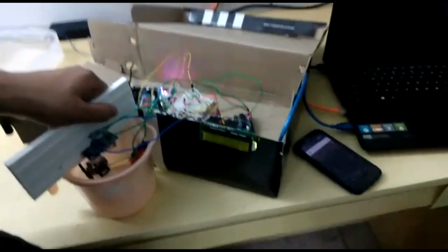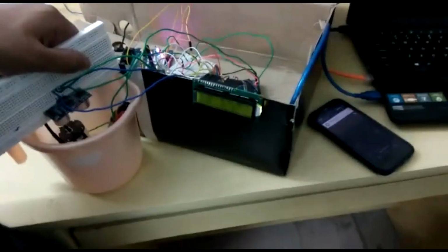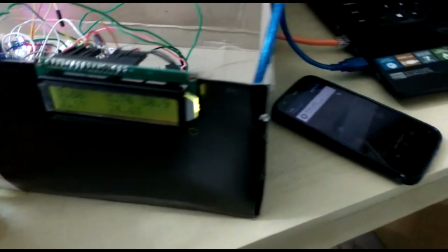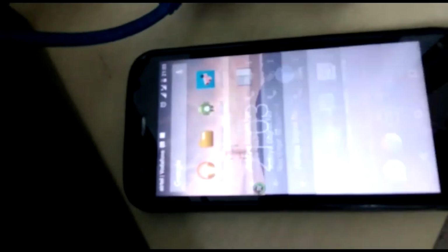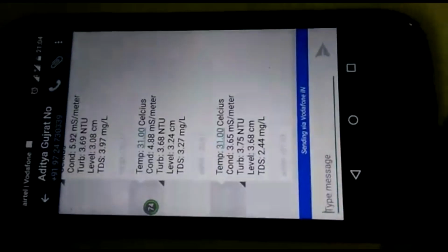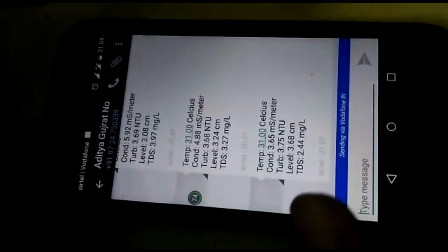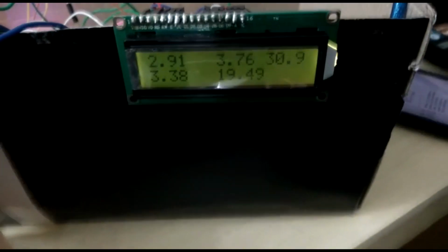Hello, here we are doing the final testing of our project. We have integrated the project with an LCD also, and we have put it in a box. This is where we are getting the reading on the LCD, and there is the mobile, and there we got the sound of the message. So the SMS is there with the specifications, and this is the current message, which is showing the current time also. At the same time we can see the current readings on the LCD also, and you can tally the readings a little bit with the message.